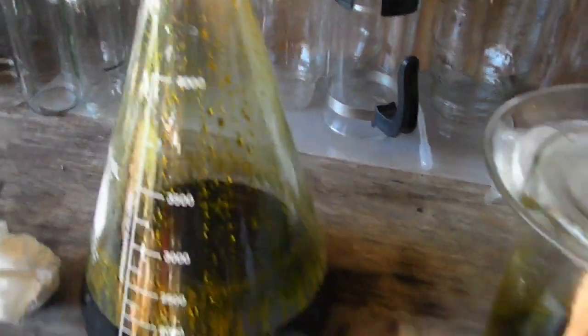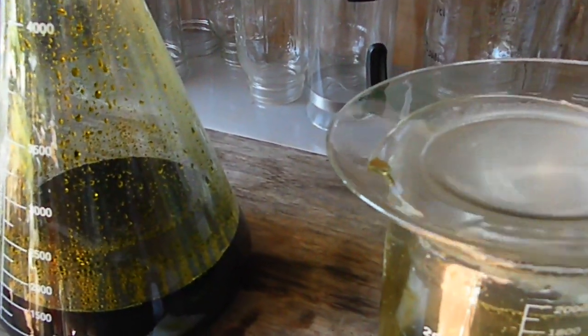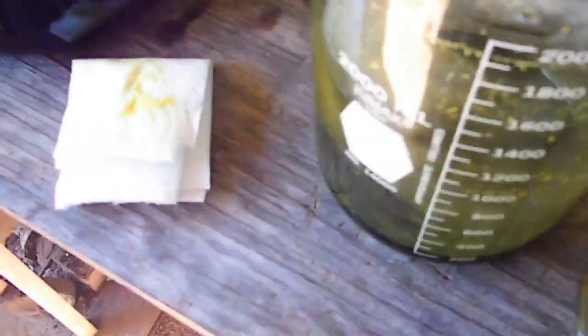When the funnel gets halfway down it goes even slower. We still have about 200 milliliters left to do on the original first filter. There is some stuff in here - this is now day six on filtering. What was on the bottom I actually didn't siphon off because I was going to filter it in these coffee filters. It's rolled up into like a little - if I stir it up it'll break back up loose, but it actually kind of rolled up like a very fine powder in the bottom.